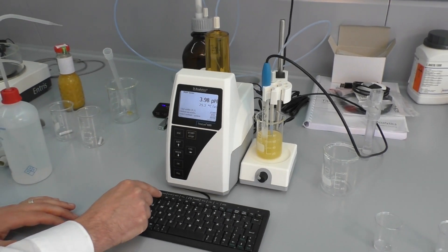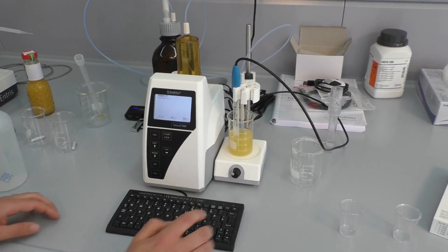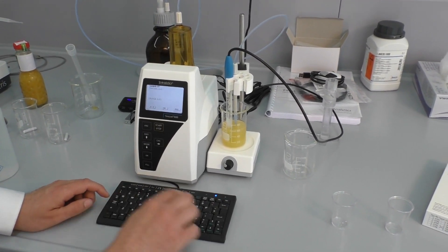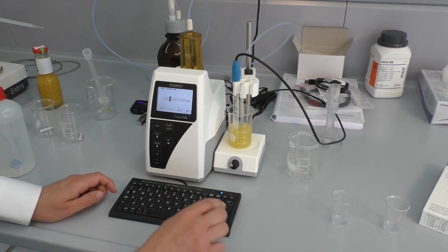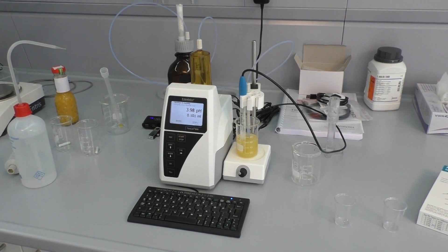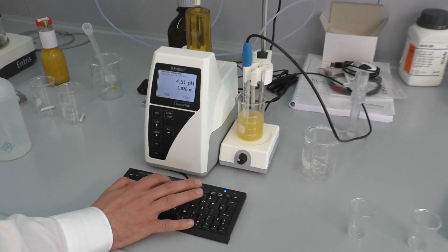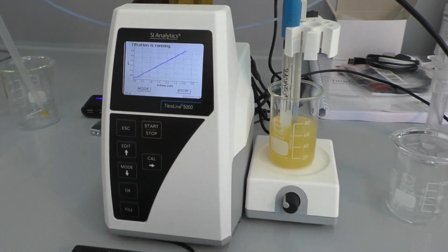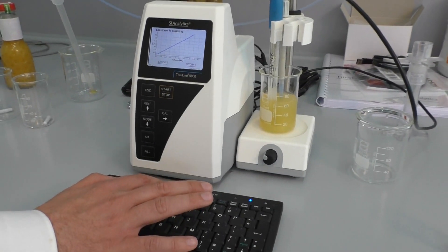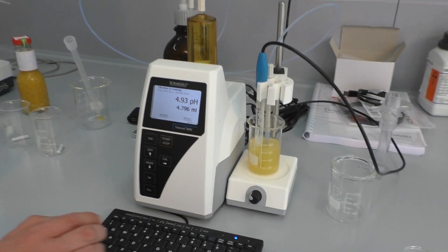Then we can start the titration with the F1 start key. The titrator asks for the name of the sample. The volume was 10 ml sample volume. And then the titration starts. With the mode key, the online curve of the titration can be seen — you can switch to that online curve, and again with mode, the screen with the current pH and volume can be seen.